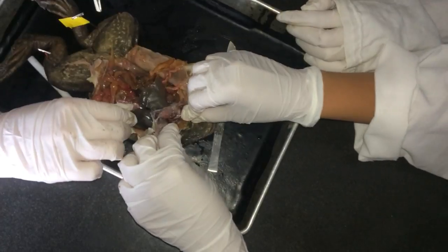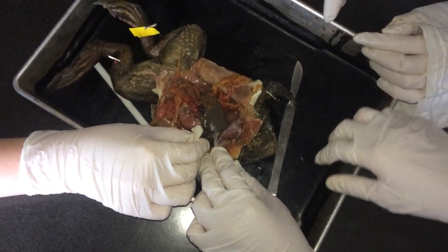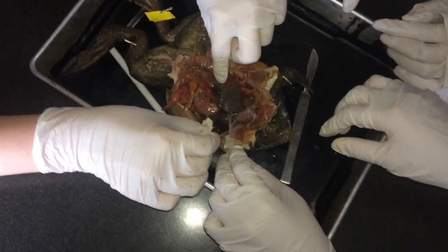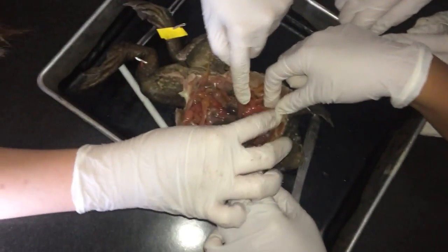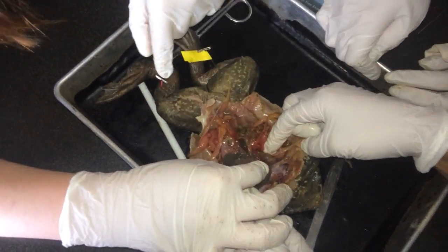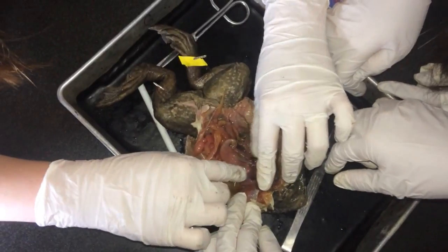Well we can pin the liver. Does someone want to write liver? Here's a pen. Do you want to find one? I don't know. What is this? I think that's... oh, this is the liver. Okay. And so the lungs are on the very sides. I think this is the lung. Yeah. That's definitely a lung. Is it the same on the other side? Yes. It's tiny, but yeah.